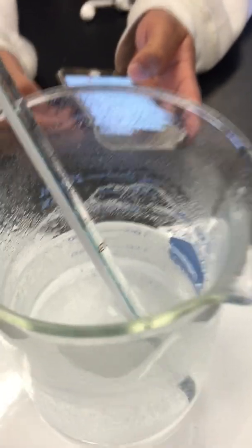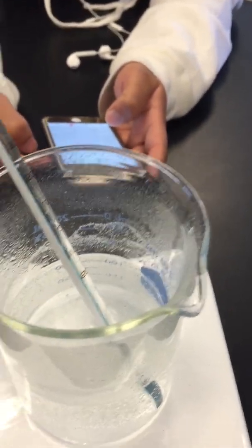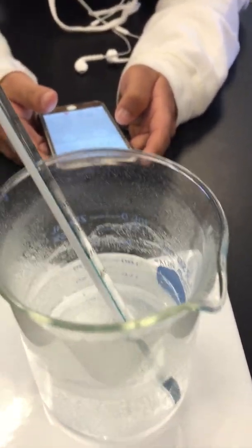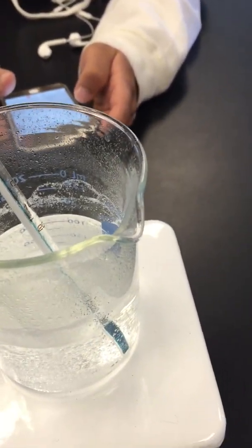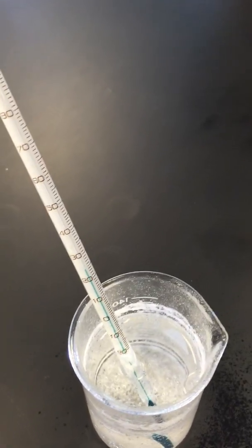Okay, so now we're learning about it - it's more effective right here. Yeah, it's already done. Yeah, so we have two reactions, very similar, but they take different times. So now we know what our reaction is and we're starting to think about what different factors or what different variables are going to affect how quickly these reactions happen.